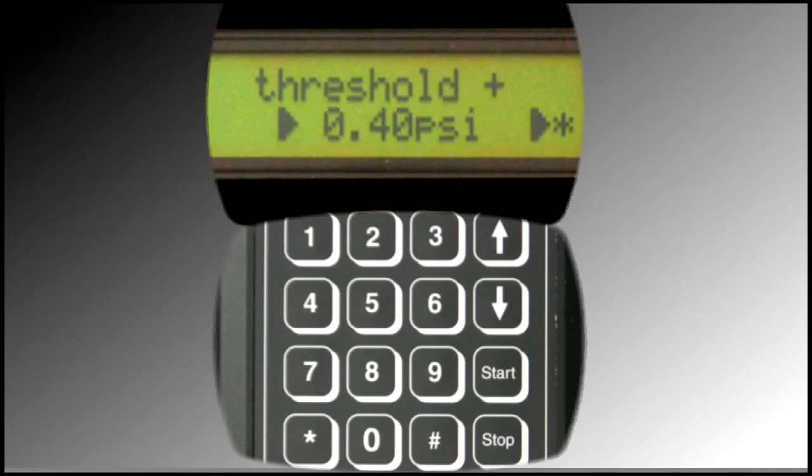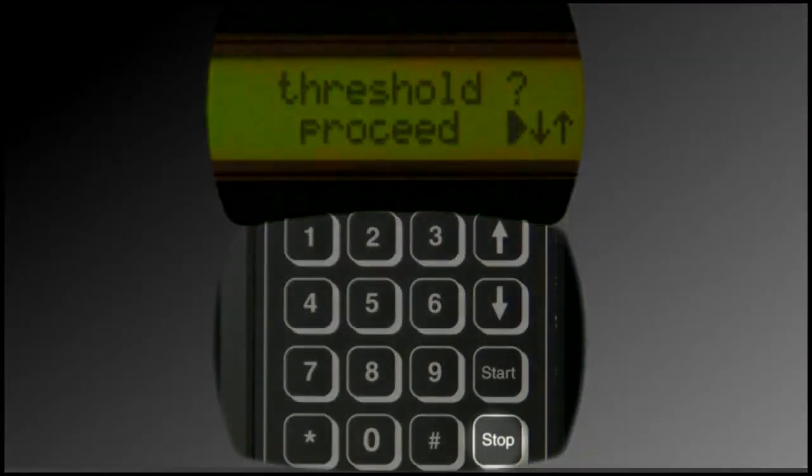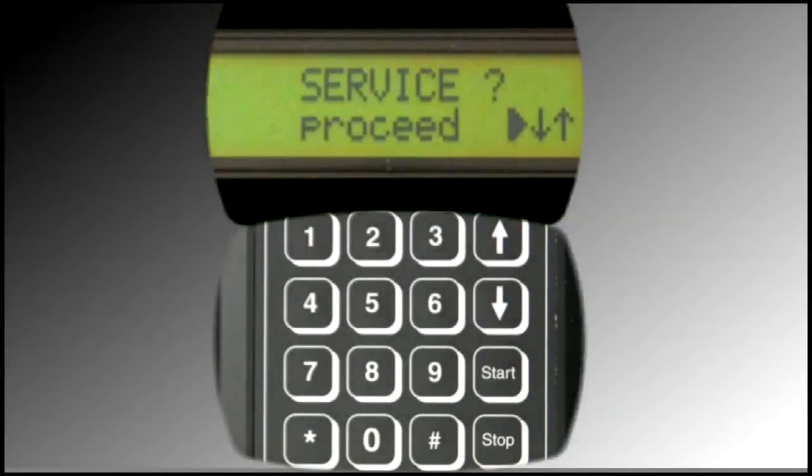As with the lower pressure threshold, the setting programmed must be between 0.14 and 1.45 psi. A larger pressure threshold setting allows for more tolerance of slight pressure variations during the integrity test. A more narrow pressure threshold setting ensures variation from desired test pressure is minimal. Press the Star button to save any changes made and to return to the main threshold menu. Press the Stop button to return to the main service menu.